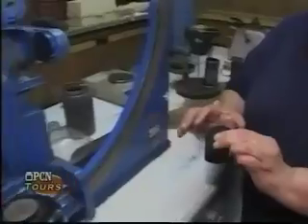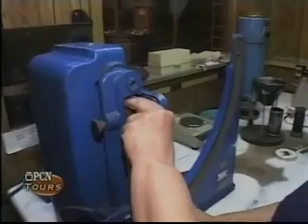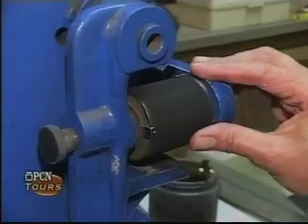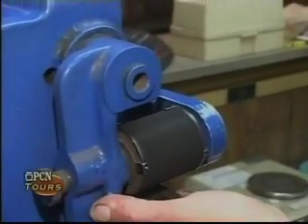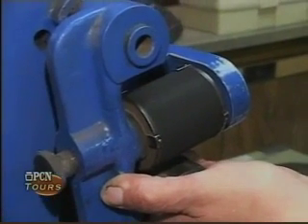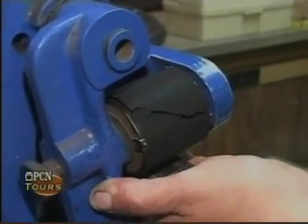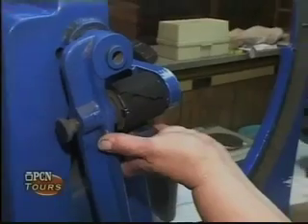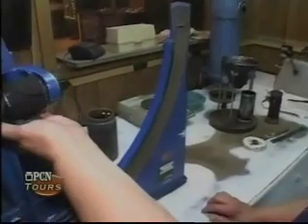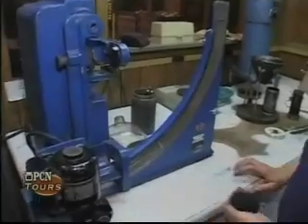Now the specimen sand will be placed into a tensile machine. Our sand consists of a bentonite clay, of western and southern bentonite, and about 3% moisture, about 5% clay. You can see the sand fractured, and there's a magnet on the scale that tells us exactly how strong it was before it broke, which is a green strength number of about 23.